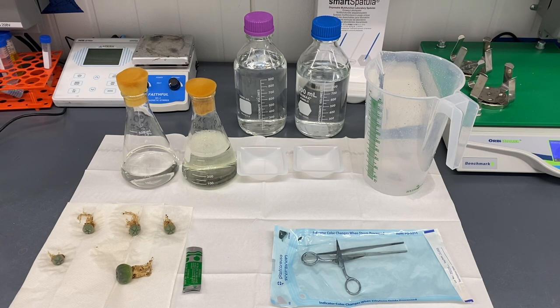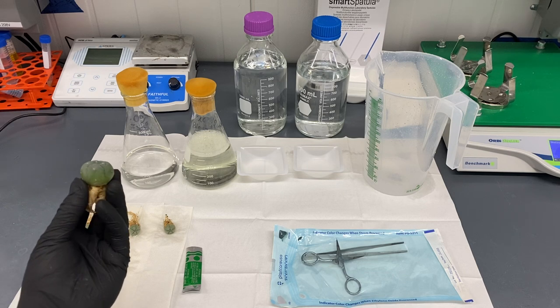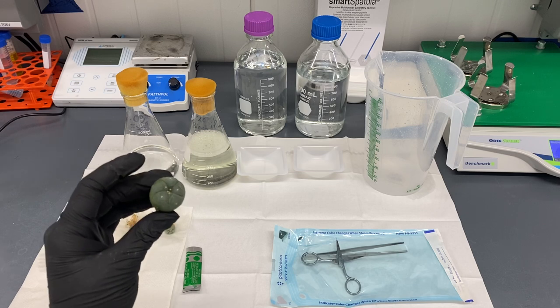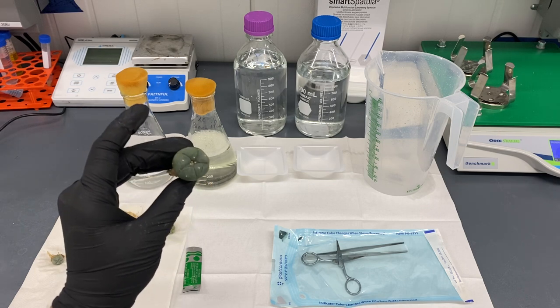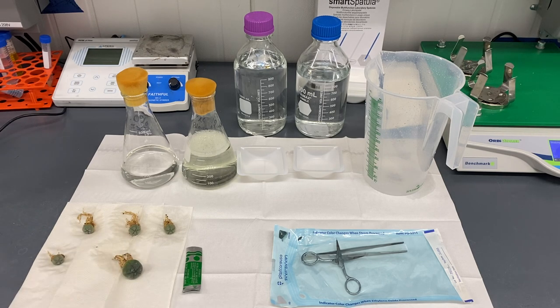Roots are really dirty on almost all plants, so instead of trying to do tissue culture on the roots - which most likely will get contaminated - we're going to replant the roots so they can propagate. Then we're going to take the top green part of the cactus and cut that up as explant. Everywhere you see a white spot is a meristematic cell spot, the tufts of the Lophophora - that's what we're going to cut up into smaller pieces.